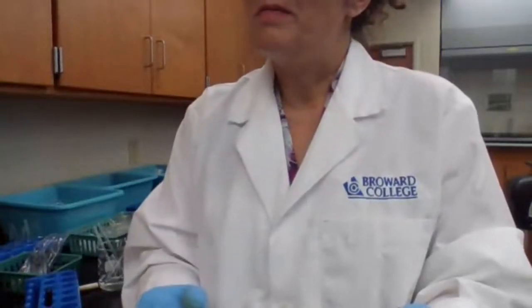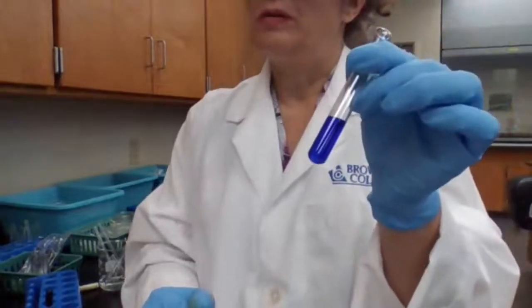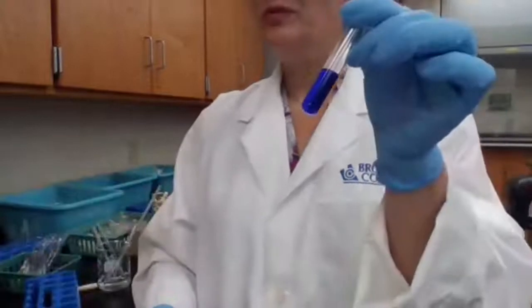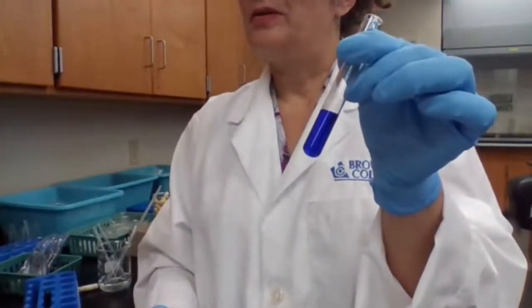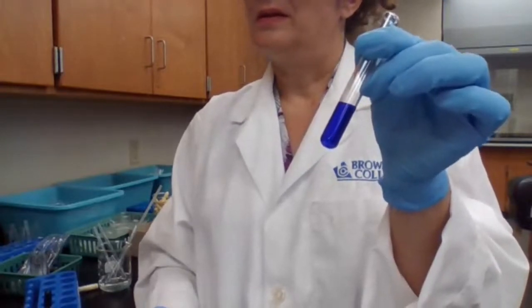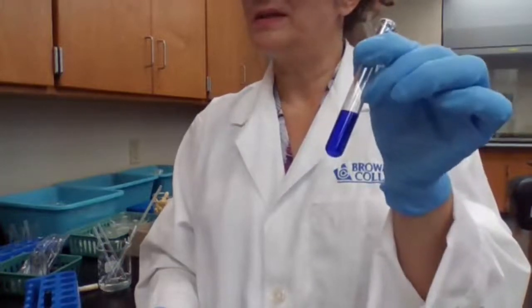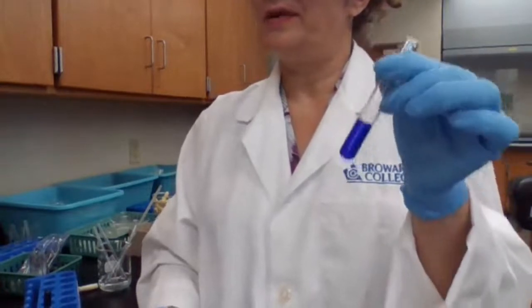I'm going to move to part 2D because I didn't have precipitate. I cannot do part 2C now. Okay, so I'm going to move to part 2D. Going to add acetic acid to the blue color solution. We're going to add acetic acid until it is acidic. Then we add the K4FeCN6.